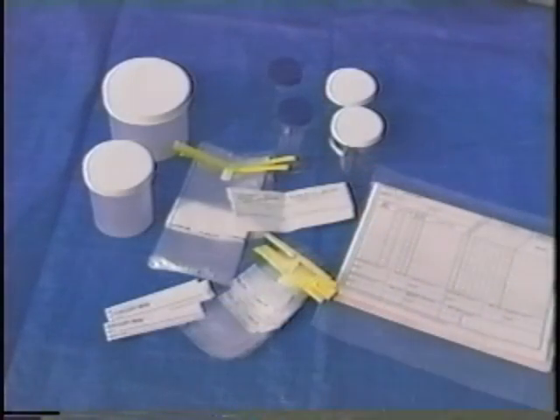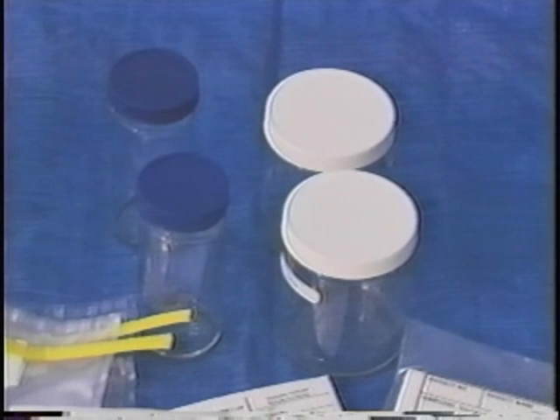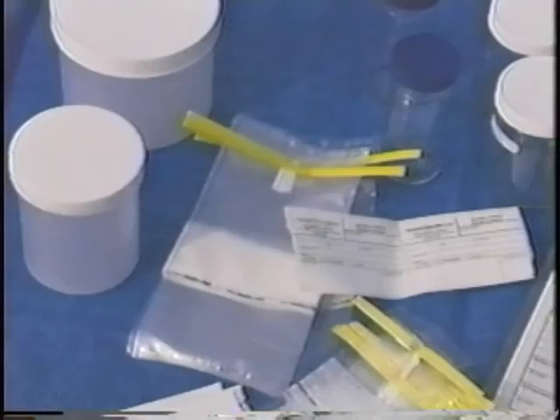Sample containers are either plastic or glass. If you're collecting samples for metals analysis, you can use either, though plastic is preferable because it does not break. When collecting samples for organic pollutants, glass containers with Teflon lids are used because most plastic containers have the potential to contaminate the sample with organics. All equipment and containers must be clean.